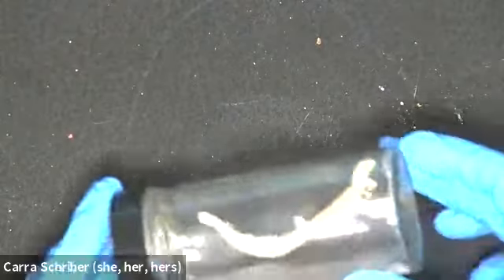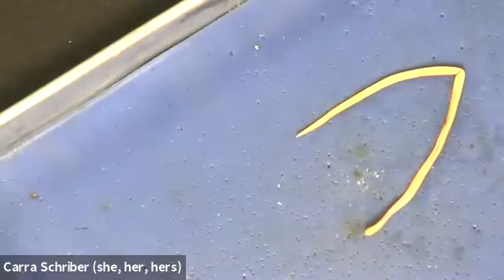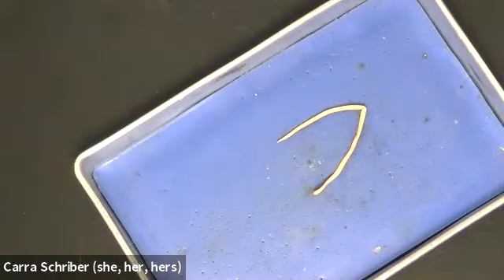Here's a different one. I don't like those samples where the air's in the sample. When you see air bubbles, it makes it so that you can't see it as well. But here's a skeletonized version. Nope, it's not as good. Let's see. What I might have to do is just take them out of the jars, which is something that I don't normally do because they're in a solution that preserves them and it smells pretty funky. But I'll do it for you because otherwise you won't be able to see them.